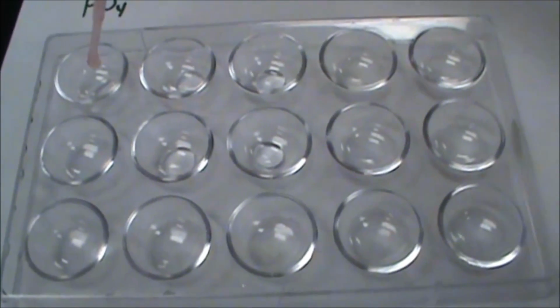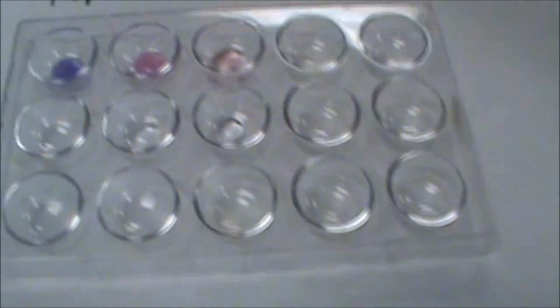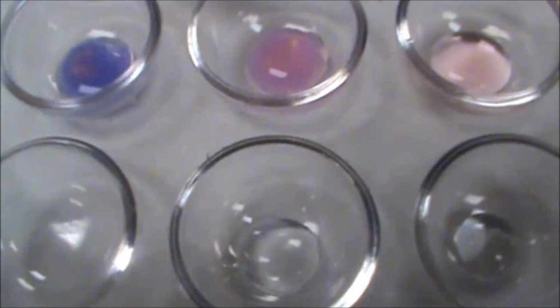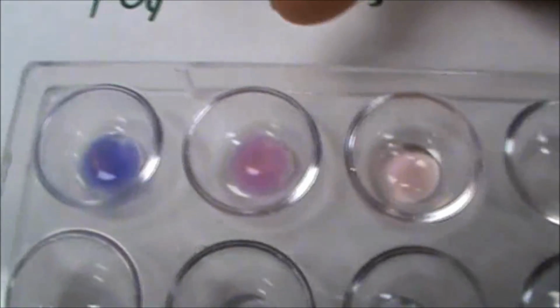So what I'm going to do is add some cobalt sulfate to each of those. And for the sodium phosphate, you can see this purplish precipitate forming, and then there's a little bit of extra cobalt in there that keeps that pink color. And the other one I have a precipitate as well, but it's not the same purple color. Clearly it's different than this one over here.